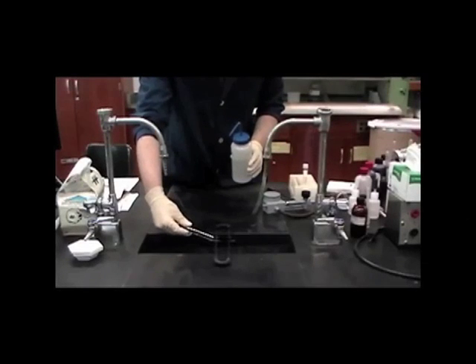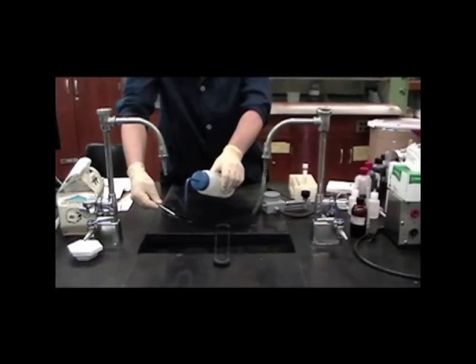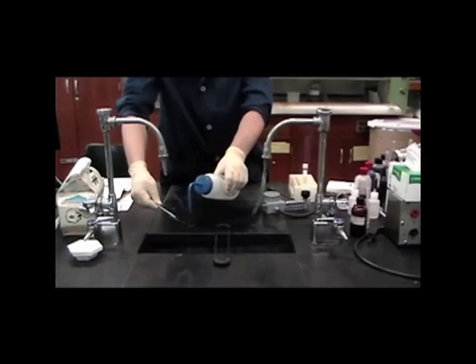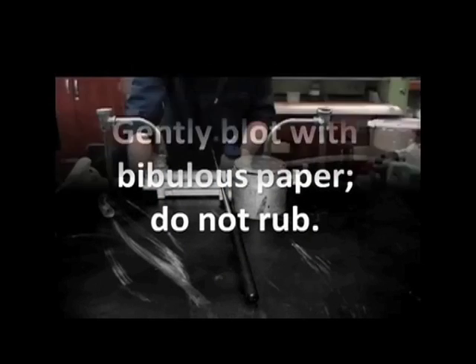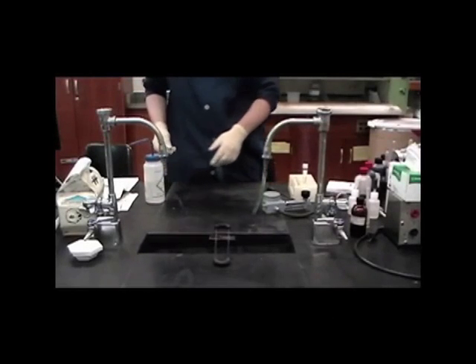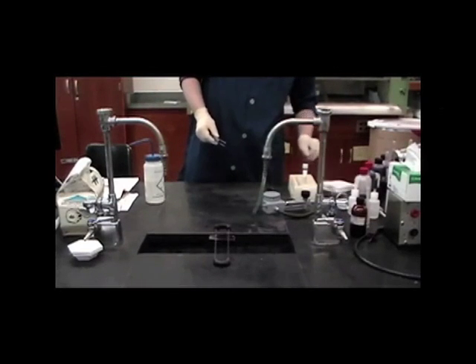The safranin is removed and the slide is then subjected to a wash with distilled water. Make sure all of the safranin is removed. The next step is to take the slide and place it in bibulous paper.